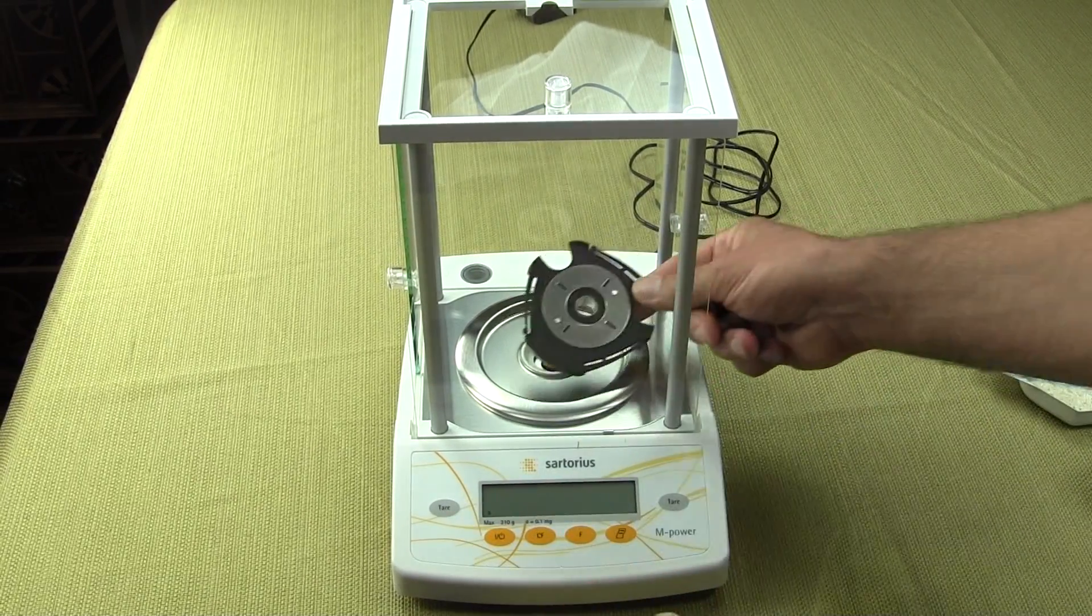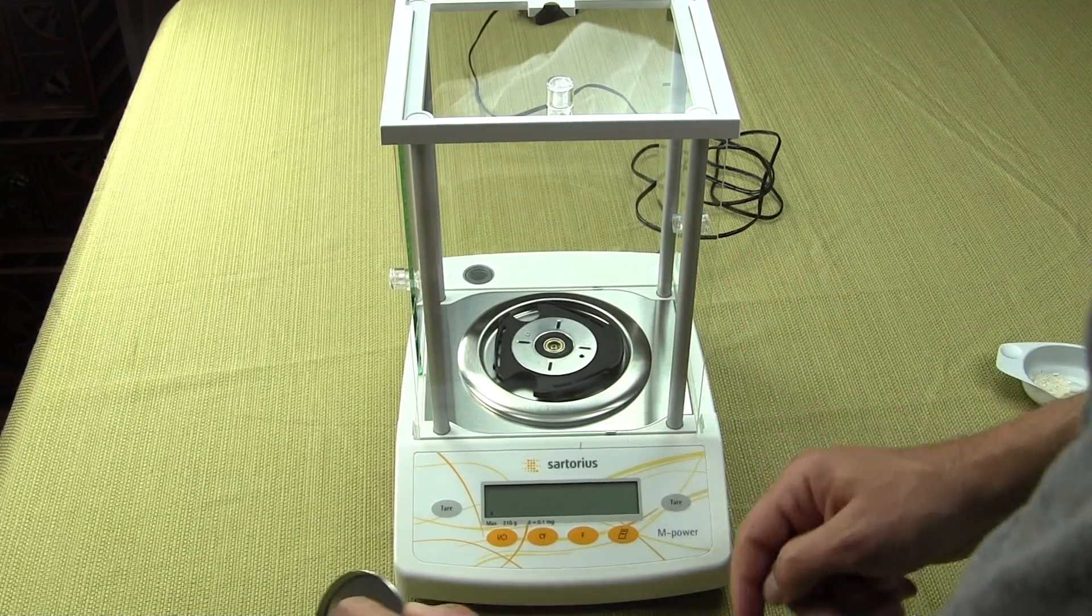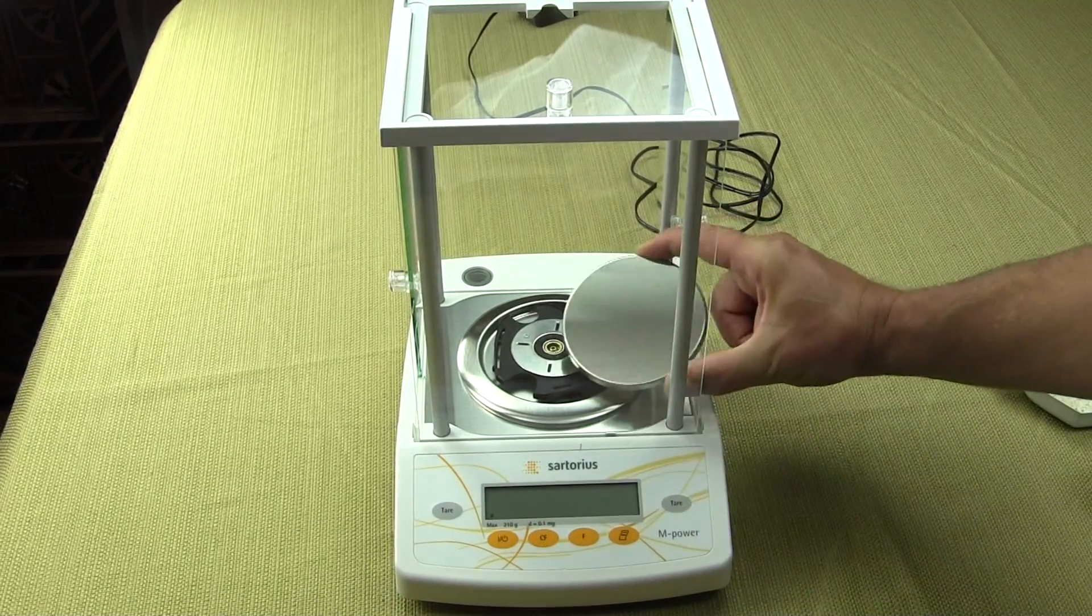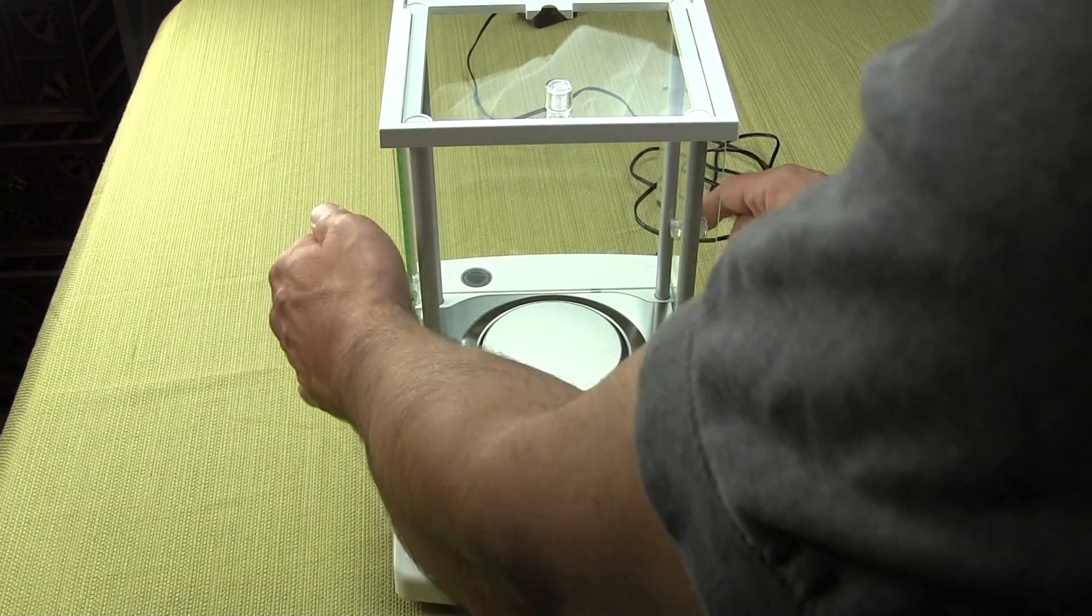And then your pan support. And then finally, your pan. So very, very simple.